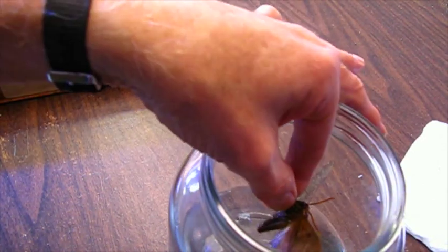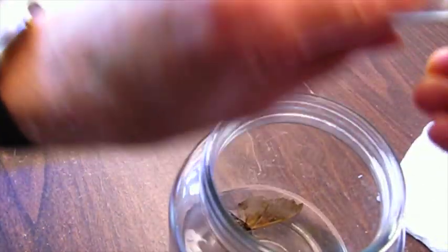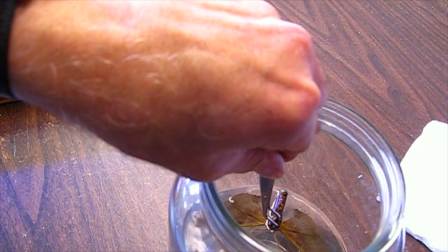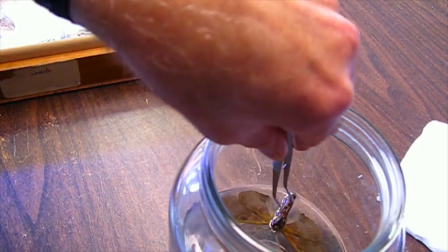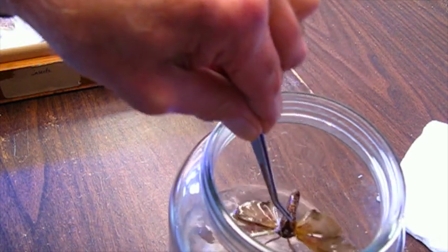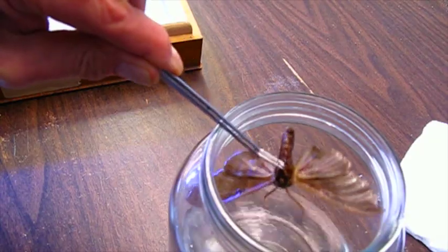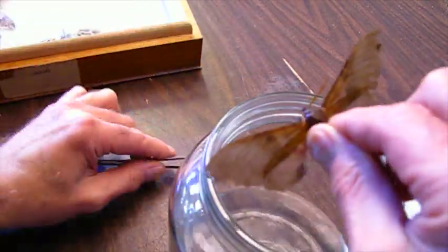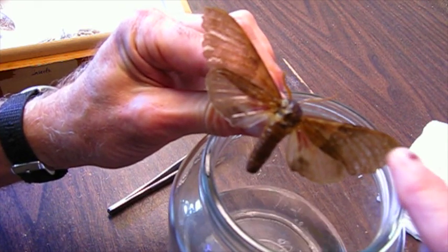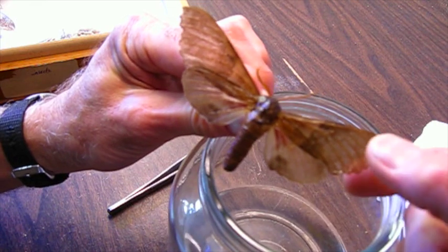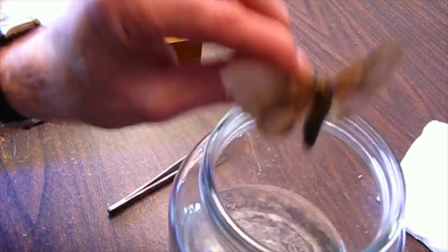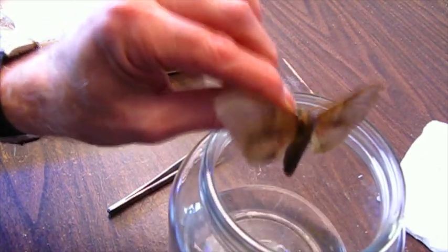I'm going to do the antennas. Now I'm going to rinse it off, swish it around in there a little bit and get a hold of the pin, just to rinse those rolls of mold filaments off. I see the wing tip, a little bit of it has folded over. Shake it off. I'm going to have to redo that label as well because that one's not really savable.